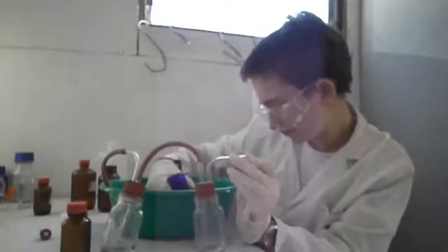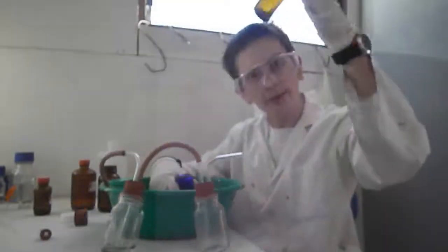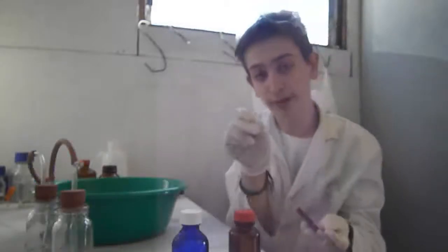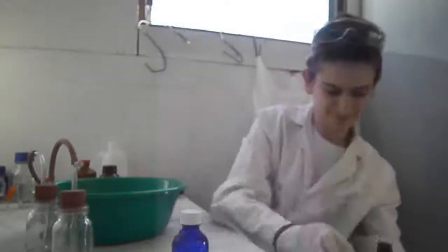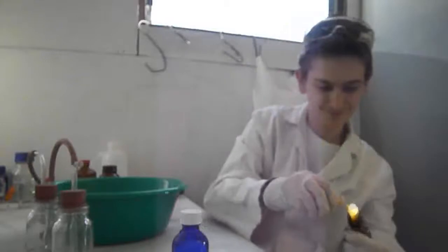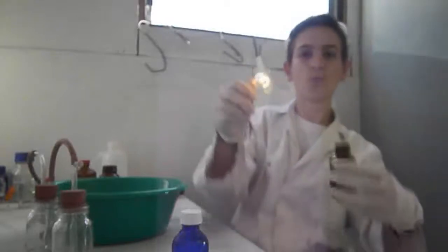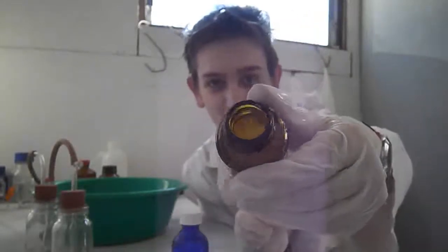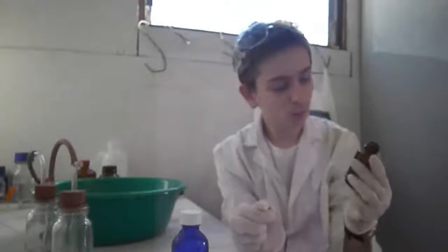Unfortunate. Oh, I see. How about we test if that's hydrogen? I doubt it. What I'm gonna do is light a match and put it above this bottle first, which I don't think has hydrogen in it. See if it pops. See what happens. Whoa! That was very unsafe. It made me very happy. That's pretty freaking awesome. So, apparently that was hydrogen.